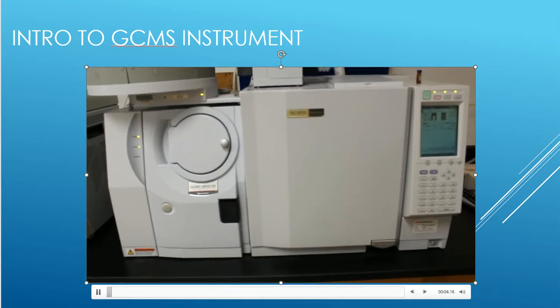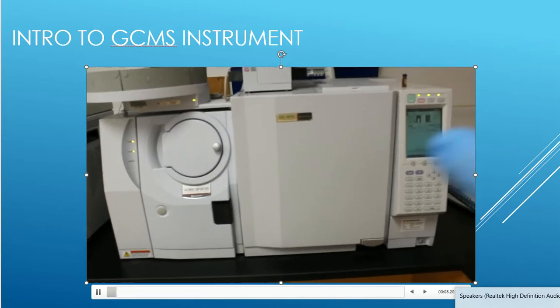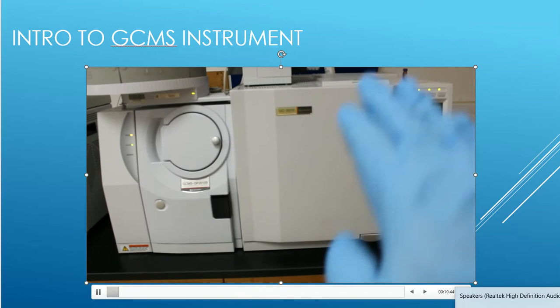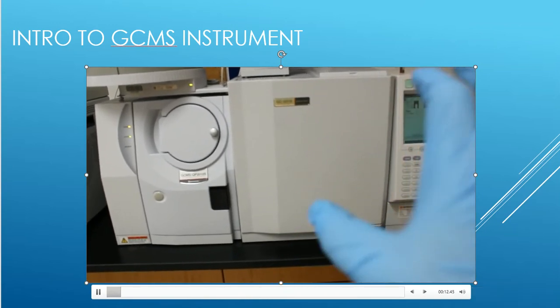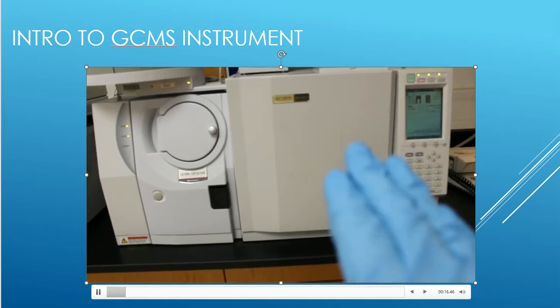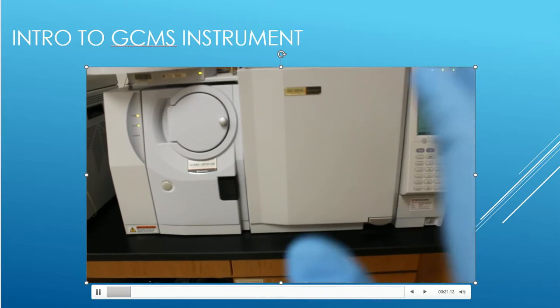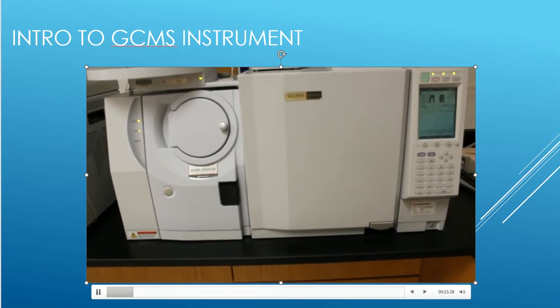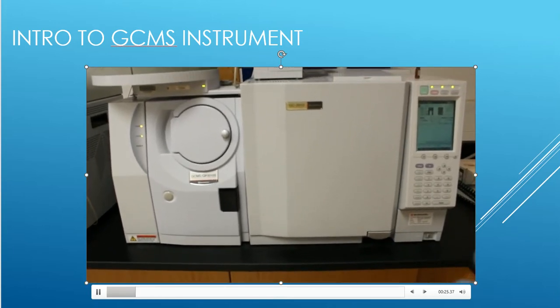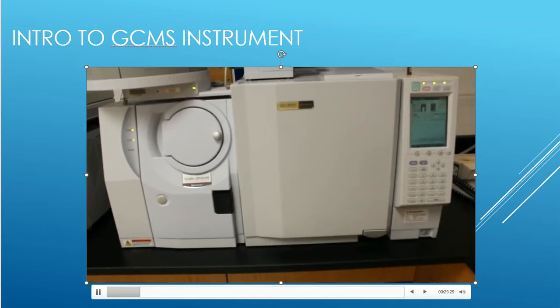All right, everyone, if you're hearing the hum, this is from our GC mass spec system. And what you're seeing here to the right-hand side of your computer screen is our gas chromatography system. We're not really going to focus on this part of the machine, because this part is only doing separation and cleanup, and that's something that we've really not talked about so far in the mass spectroscopy lecture series. We're only focused on the MS.